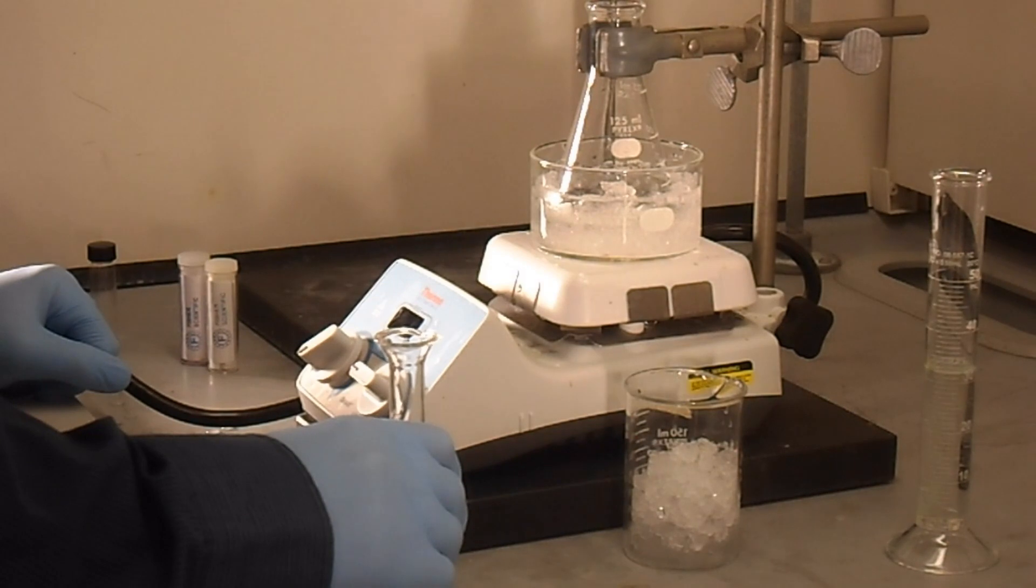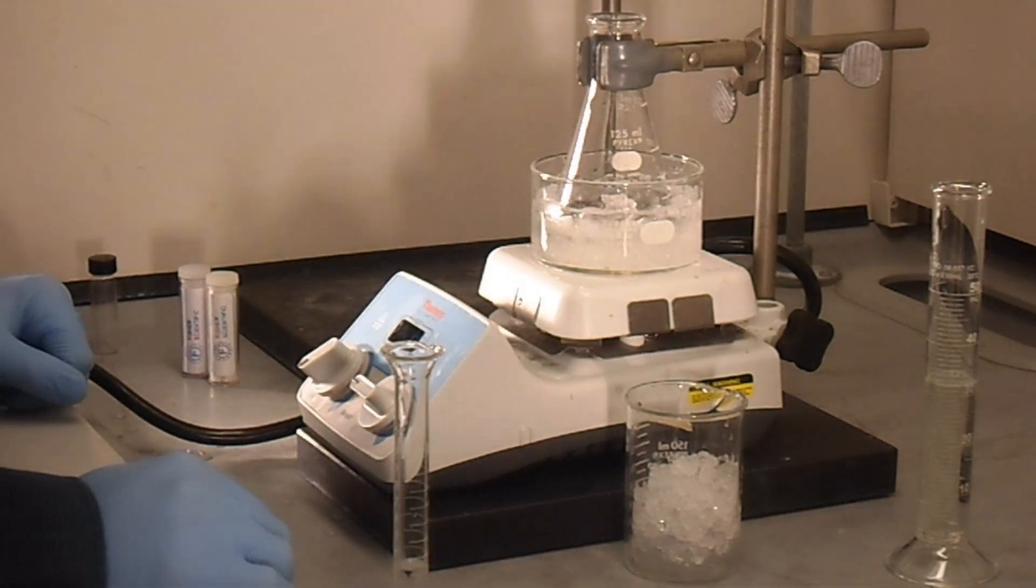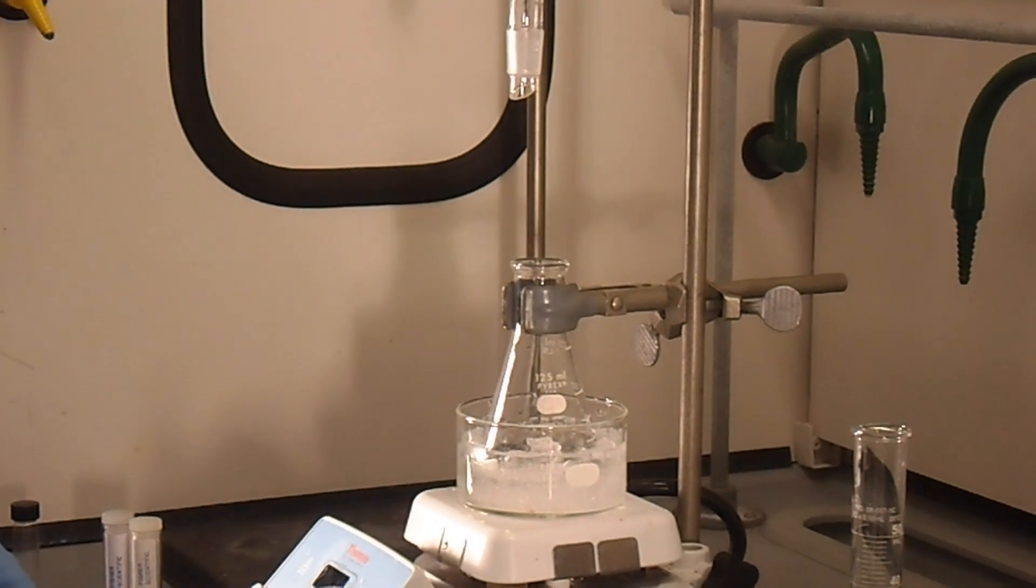Today we're going to be doing our insect repellent lab. We have most of our setup done already. We have our ice bath already pre-situated.